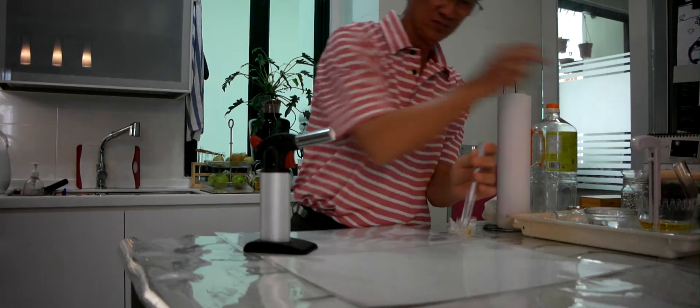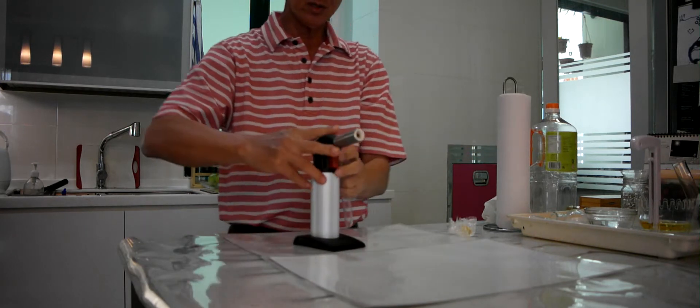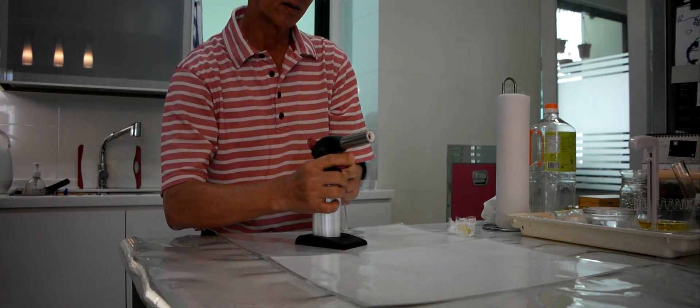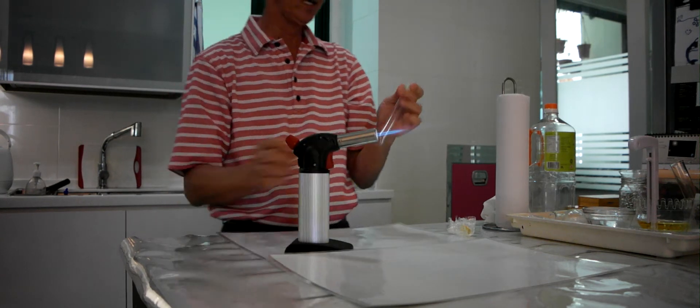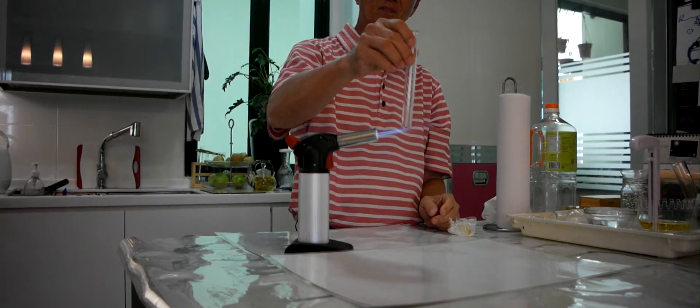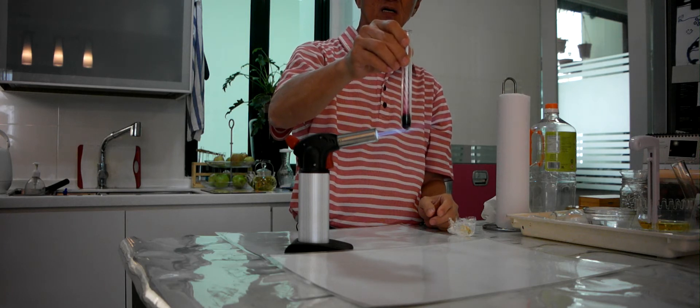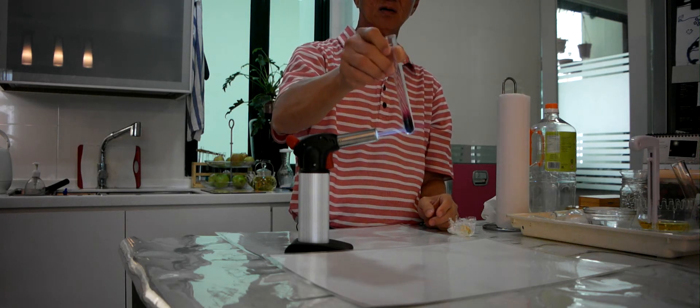Now, as I can show you, if I heat it to a high temperature, you will find that iodine will sublime. Can you see? The iodine sublimes.